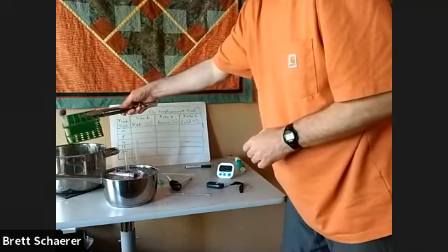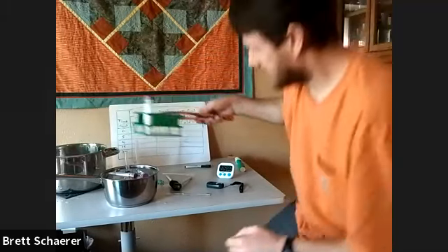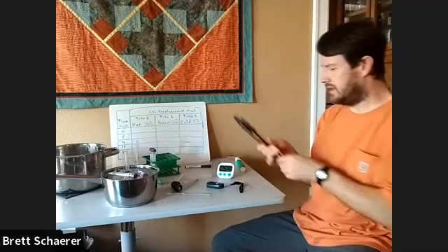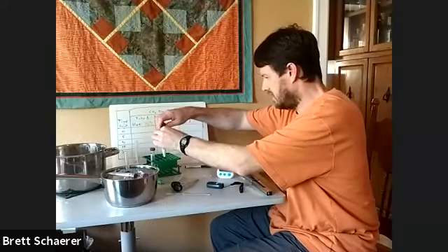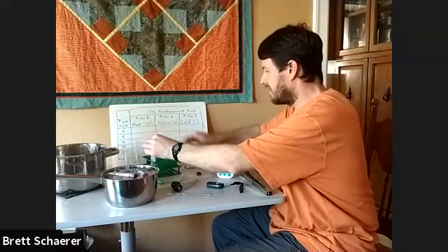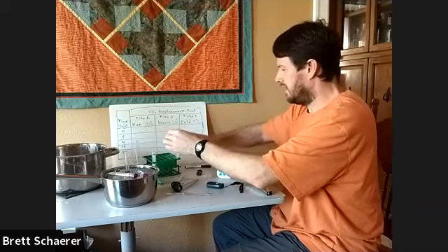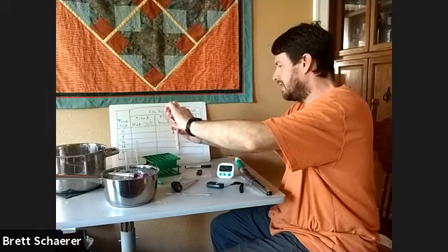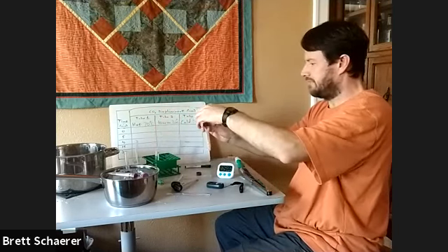The yeast and the sugar, glucose. Okay. I'm going to carefully mix these together, and I'm actually going to mix them together in the tubes here, just to make it a little easier to do the mixing process.